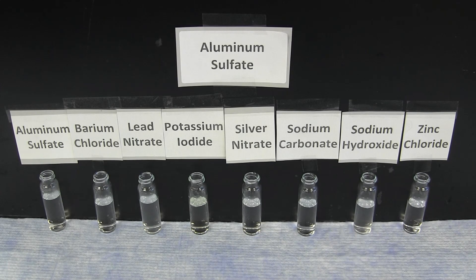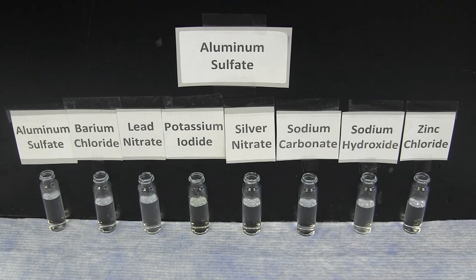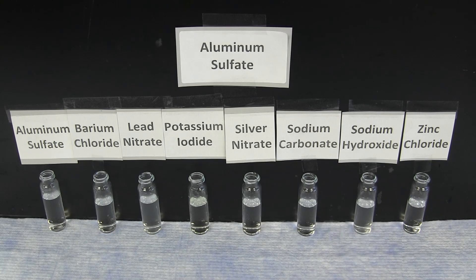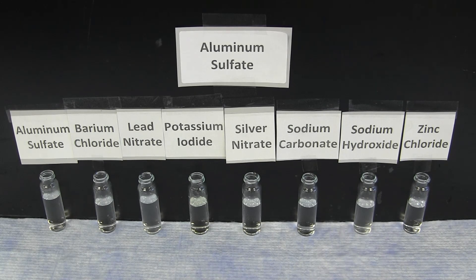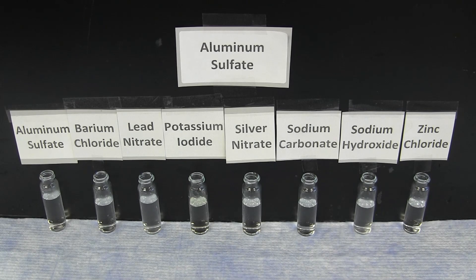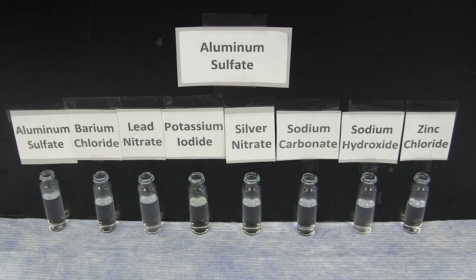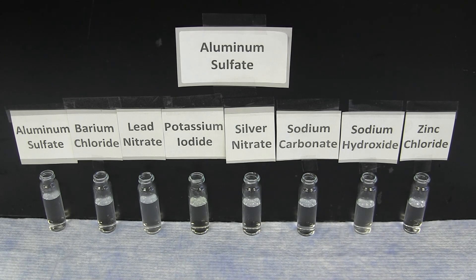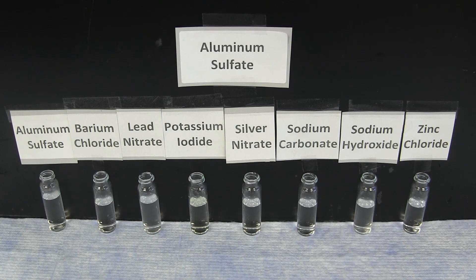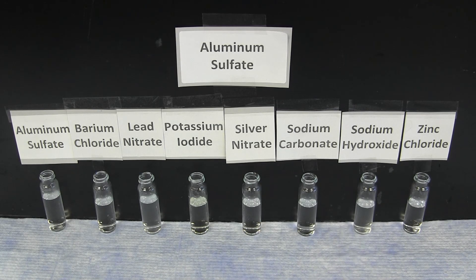All of these solutions are clear and colorless. However, when they react, different precipitates will be forming. In this experiment, a bulk of the report is looking at the different combinations and writing out the fully balanced chemical reactions, as well as identifying, based on solubility, any of the precipitates that form. In the reaction, we will be going through each of the precipitation patterns one by one over all eight solutions.